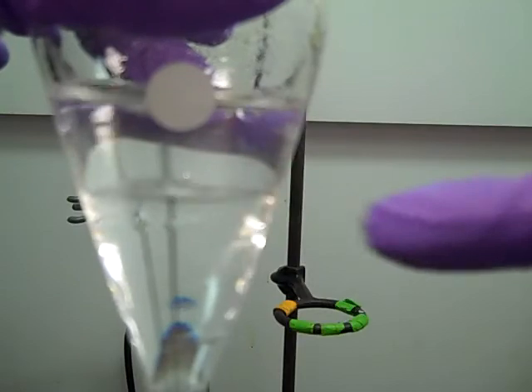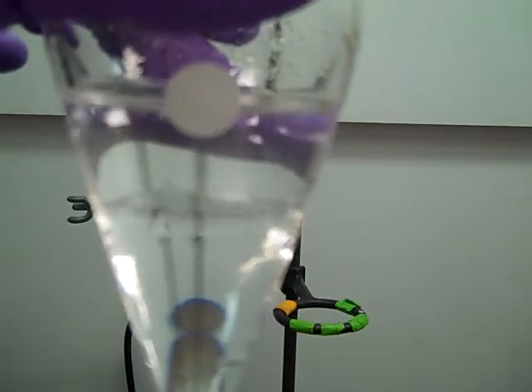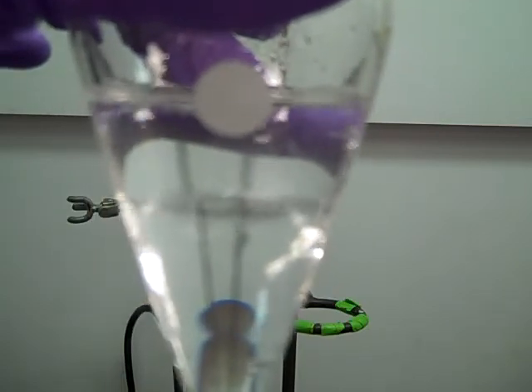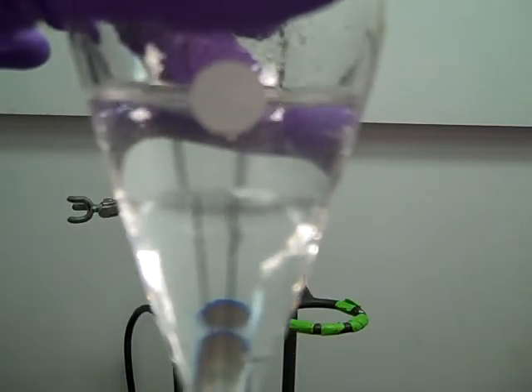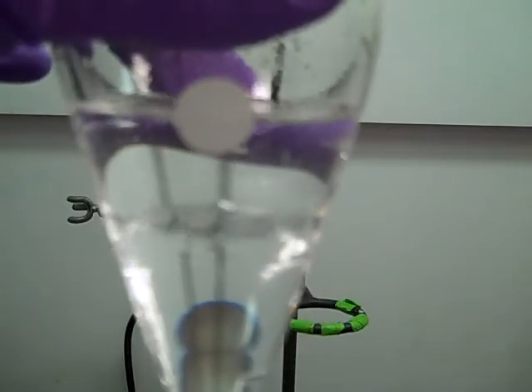If you shake this too hard, you're going to create something called an emulsion, which would be pretty relatable because that's like salad dressing. So if you shake too hard, it's going to mix up so well that it's going to be really tough to separate out. So make sure that you don't mix so hard that you create this mess of aqueous and organic layers.